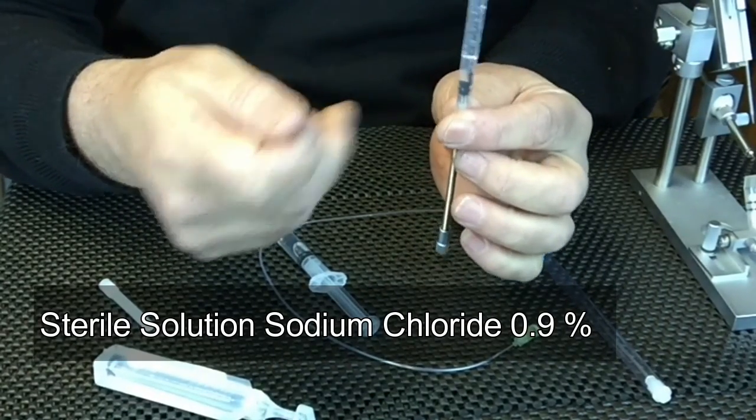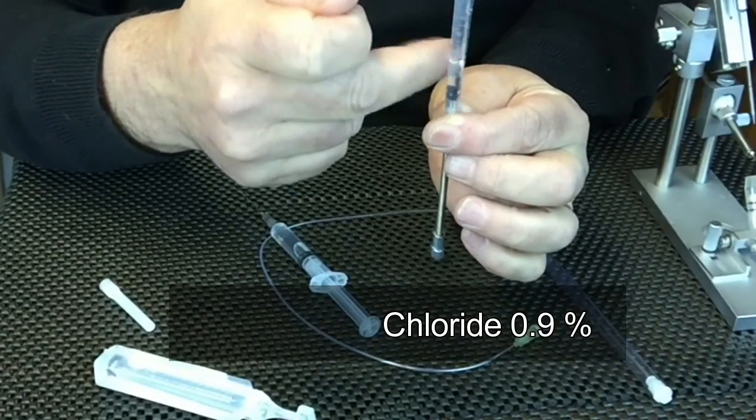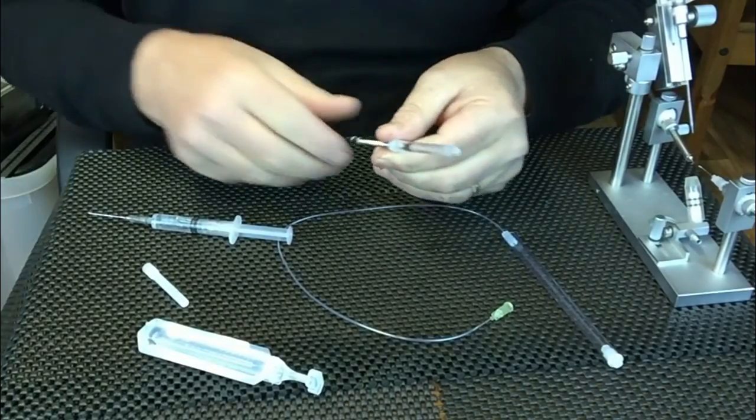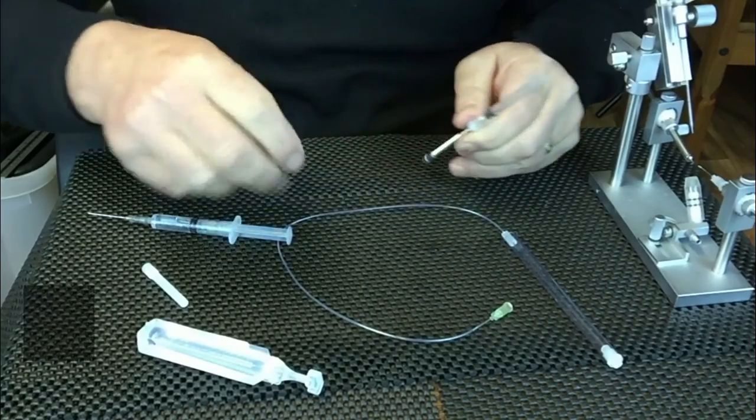We're going to make sure there's no bubbles. Now we've filled the syringe and made sure that there's no bubbles present.